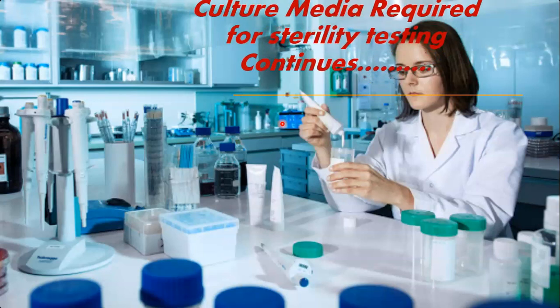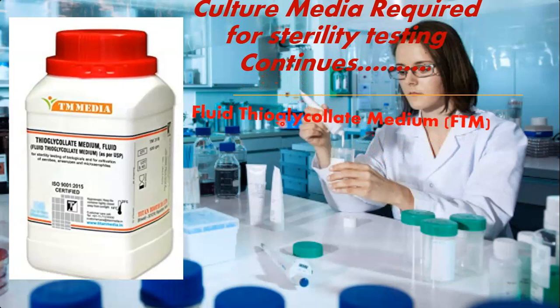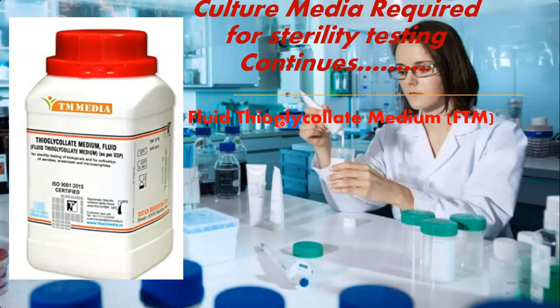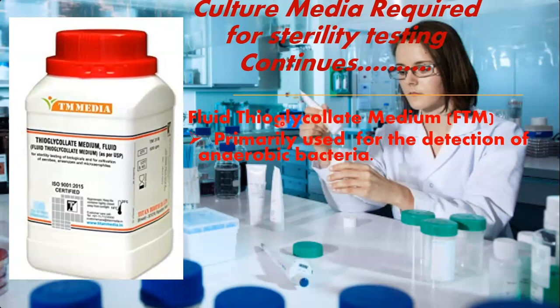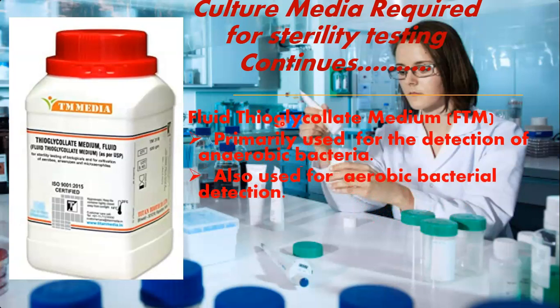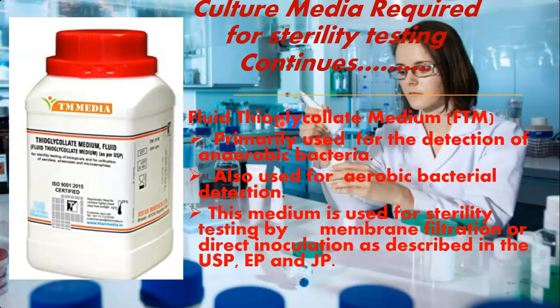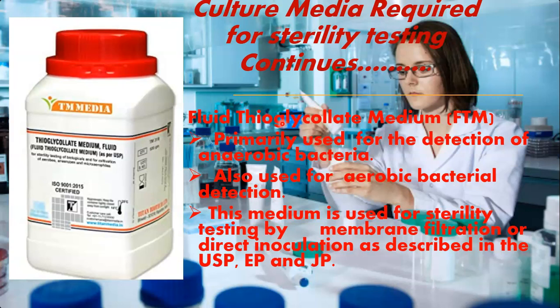The second culture medium for sterility testing is Fluid Thioglycolate Medium, or FTM. Primarily, this medium is used for the detection of anaerobic bacteria, but it is also used for aerobic bacterial detection. This medium is used for sterility testing by membrane filtration or by direct inoculation, as described in the United States Pharmacopeia or European Pharmacopeia.